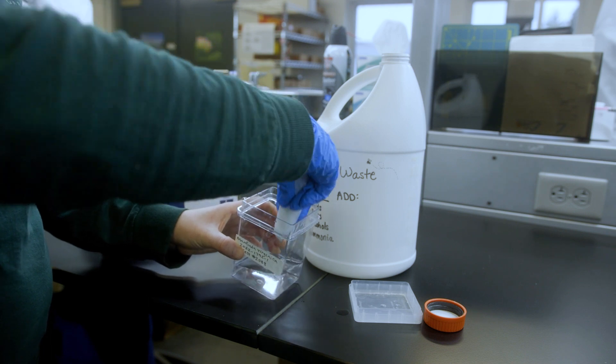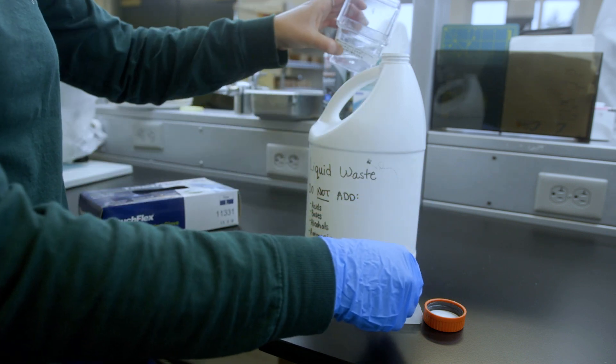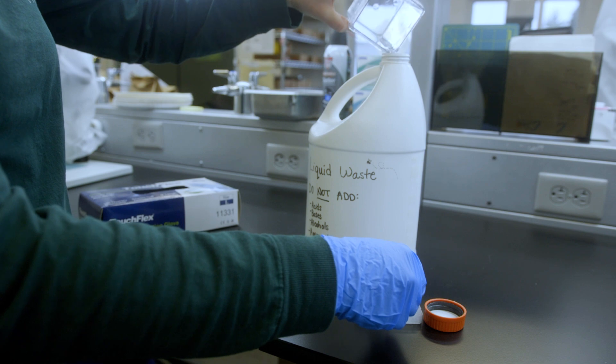Once disinfected, the filter is removed from the container and the disinfecting solution disposed of. Now it's time to plant the seed.